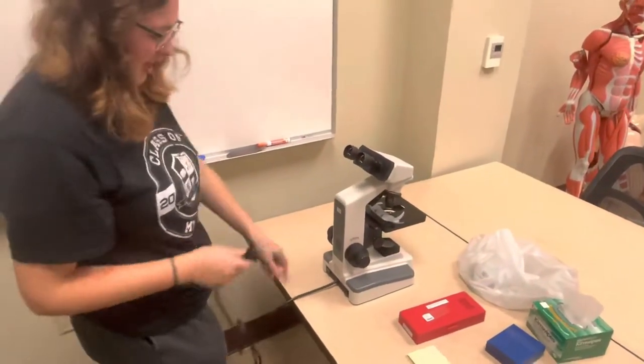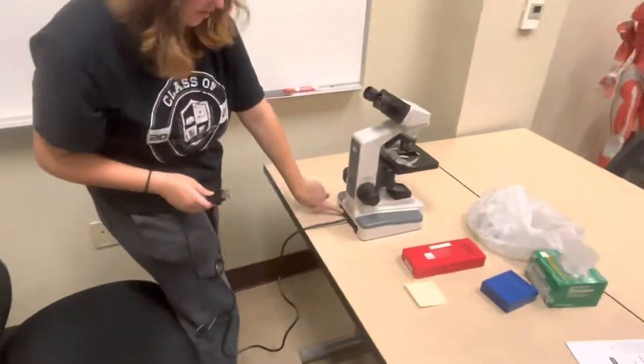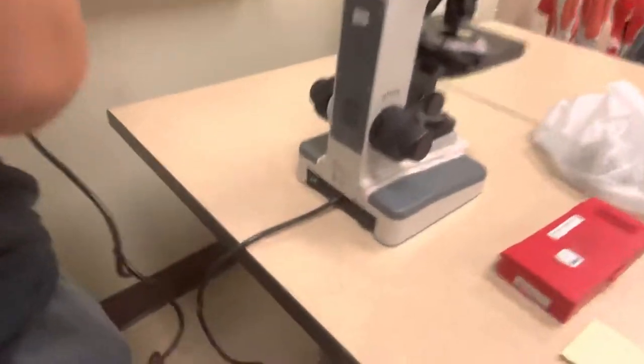Go ahead and plug it in, make sure it's off when you're doing that. You don't want it on. So go ahead and plug that in.